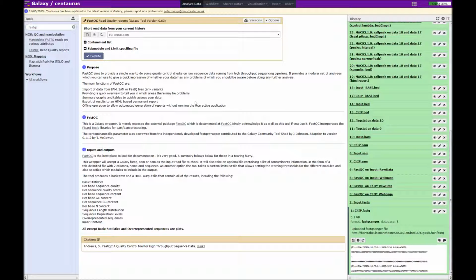The Galaxy tool page for fastQC also includes some interesting information about the purpose of the tool and the expected inputs and the type of output that is available.